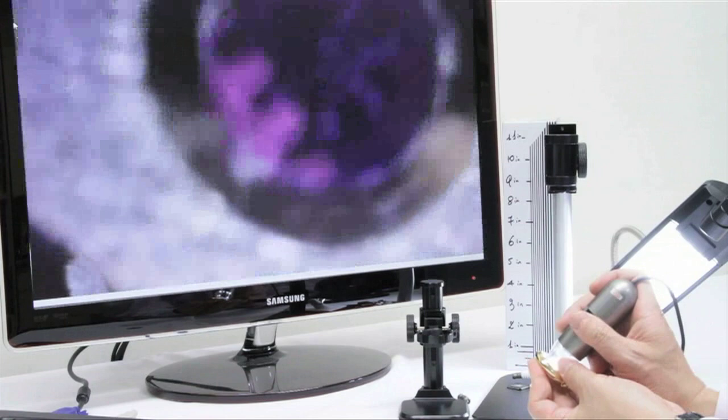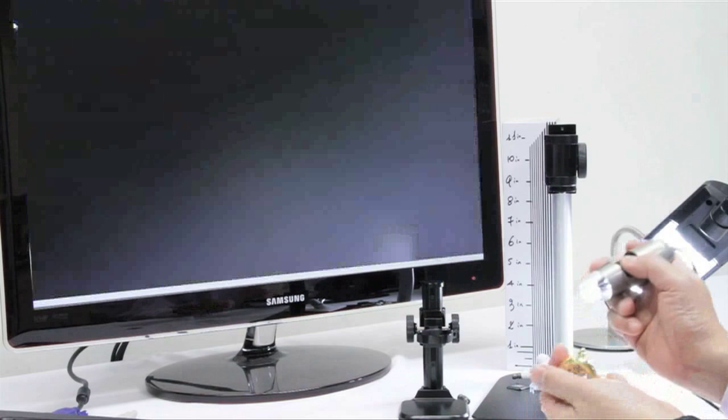Once you have it focused at 50x and need to see more detail, you can bring it down to 200 and 220 times magnification.